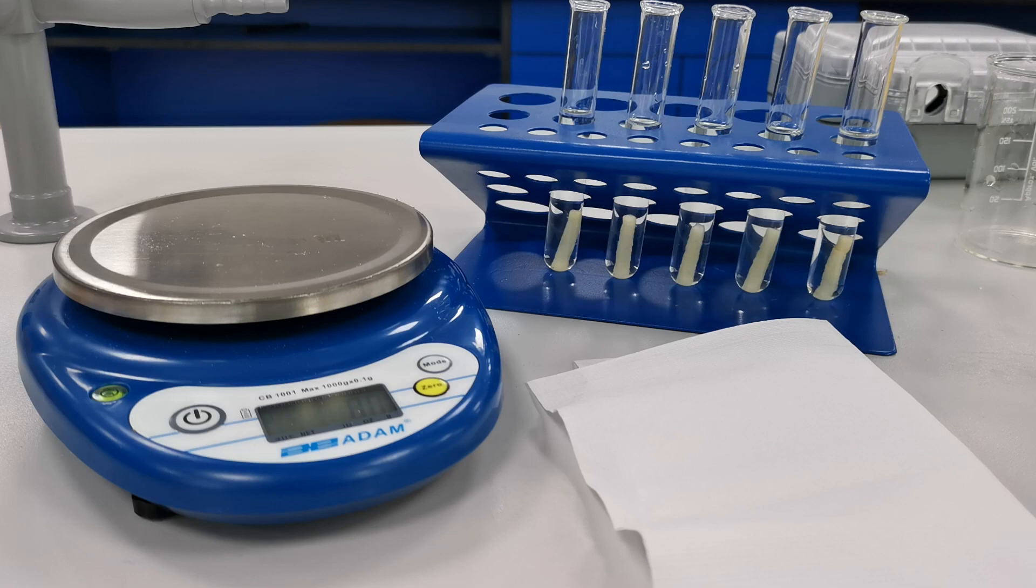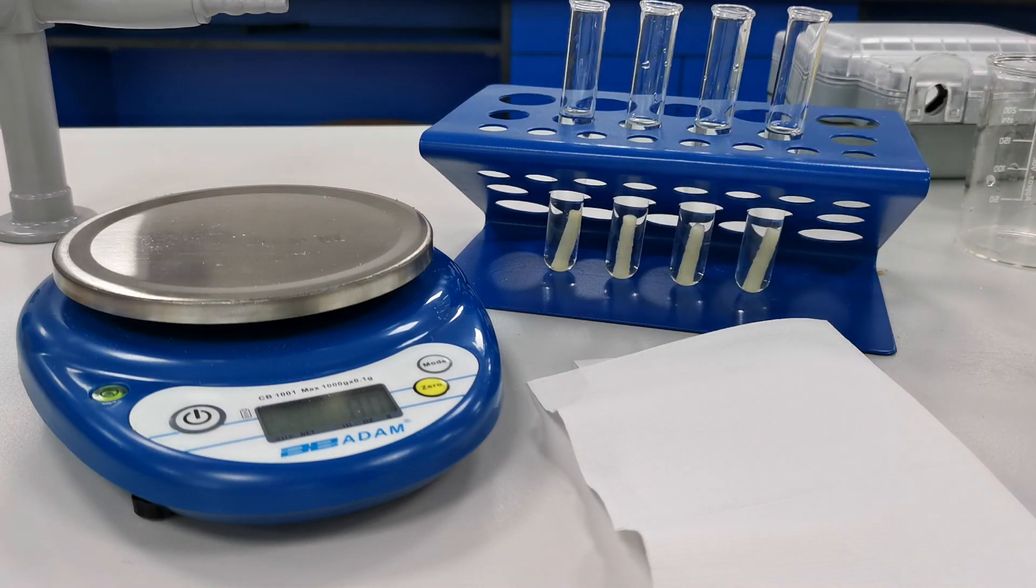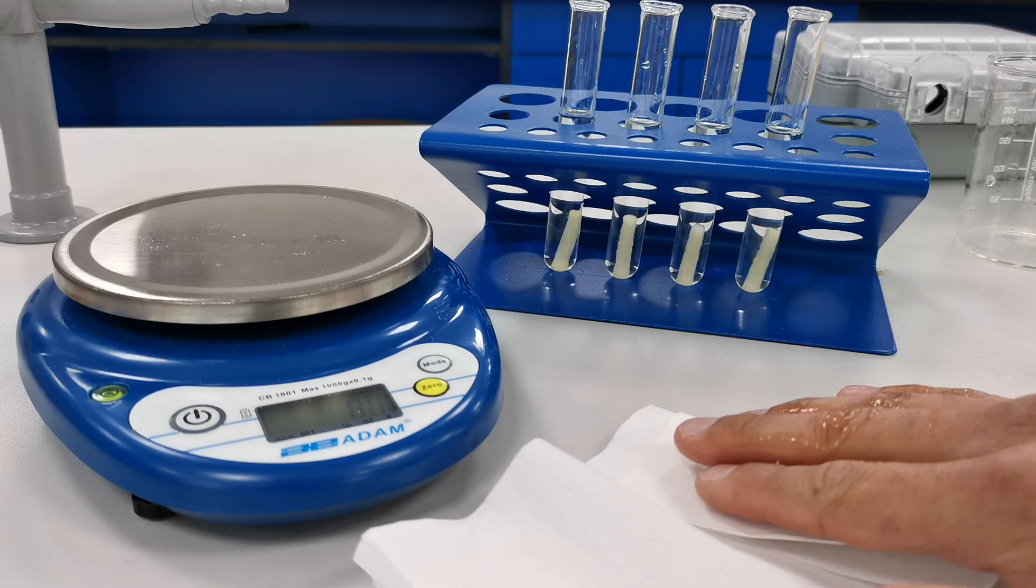OK, it's the next day. I'm going to remove each potato cylinder from the test tube. And then I'm going to pat it dry with a white paper towel just to get rid of any excess moisture.